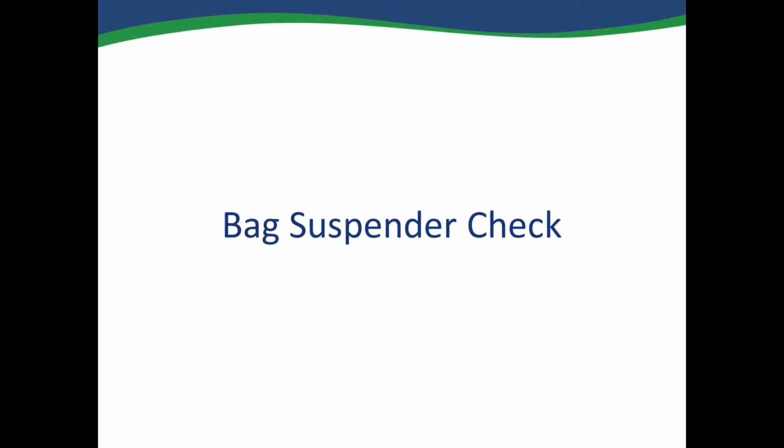In this video, it will show you how to inspect your bag suspender. It is important to inspect your bag suspender because it is critical for the extraction of your samples. Let's start the video.